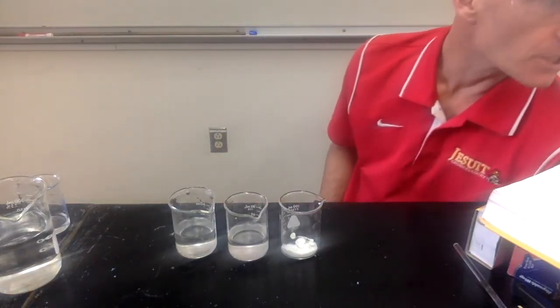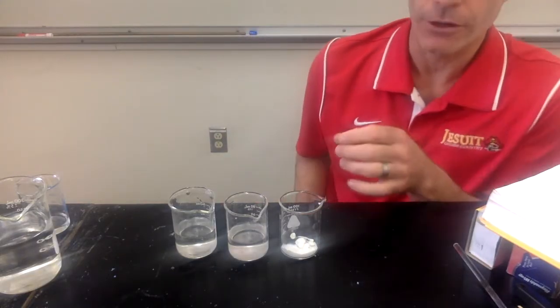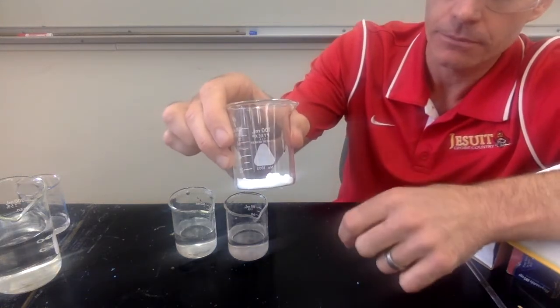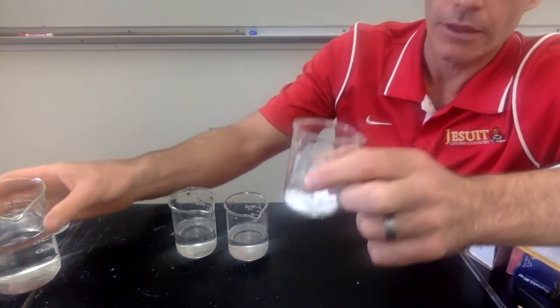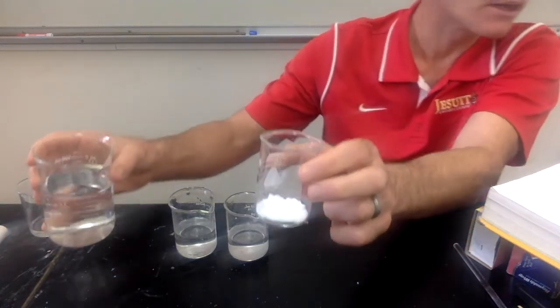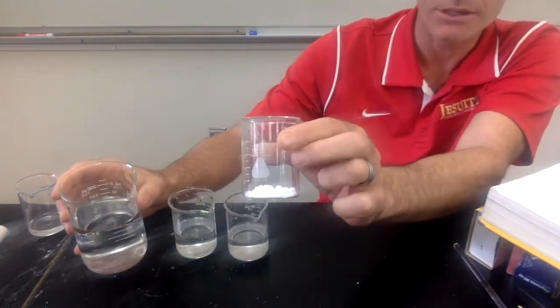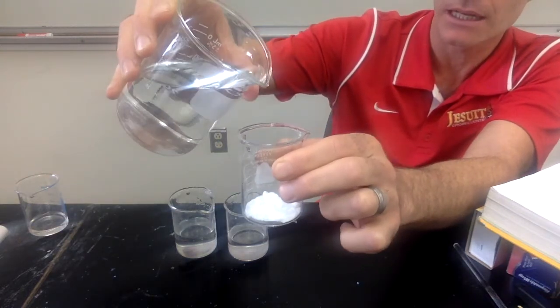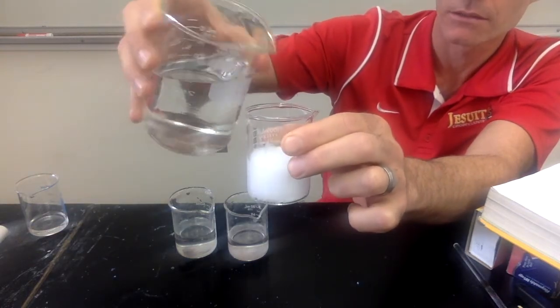This is investigation number 9. So for investigation number 9, we have a sample of baking soda. Looks like this. And then we're going to be adding to that some vinegar. In the instructions it says to use a well plate, but we're using a little larger sample just so you can see it better. So here's vinegar that I'm adding to the baking soda.